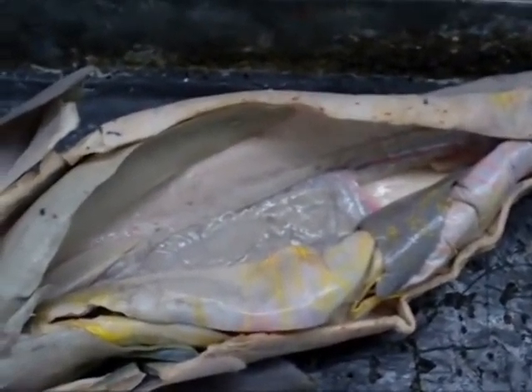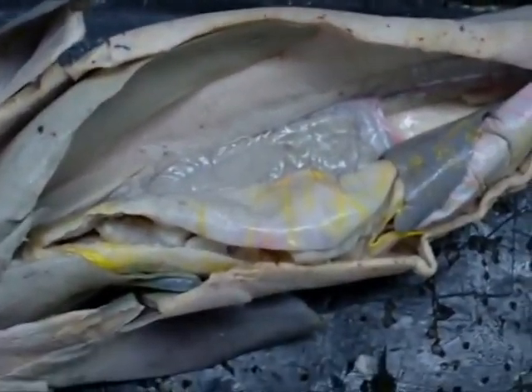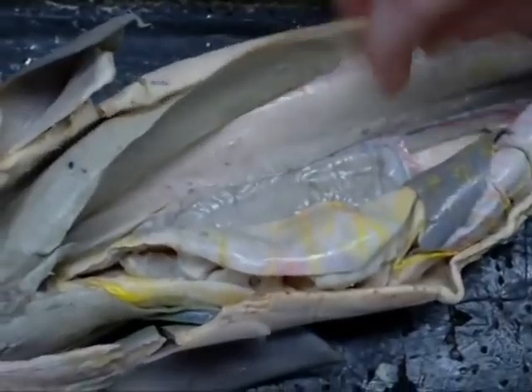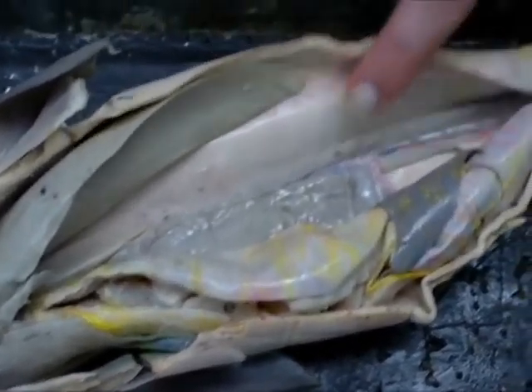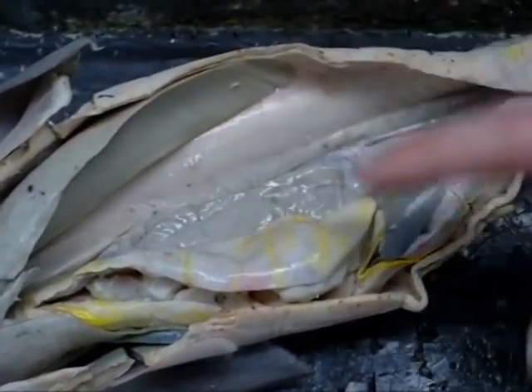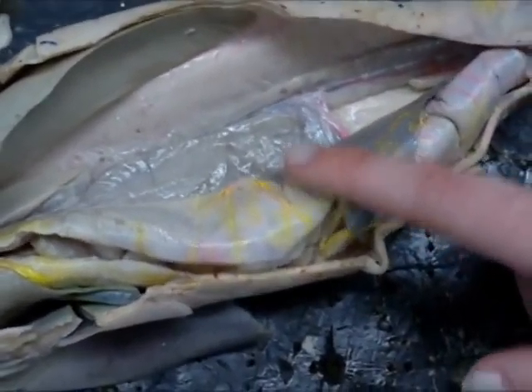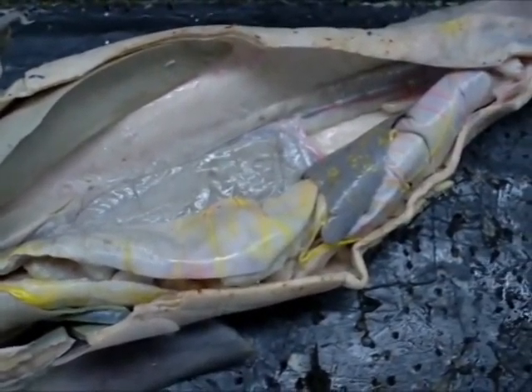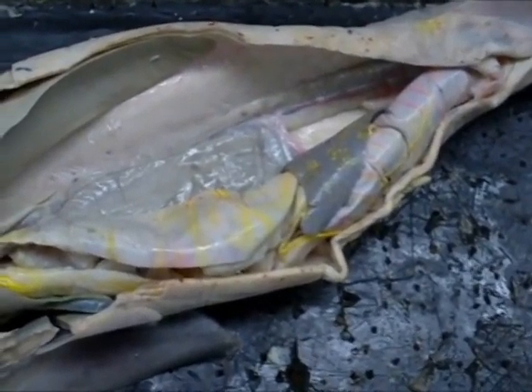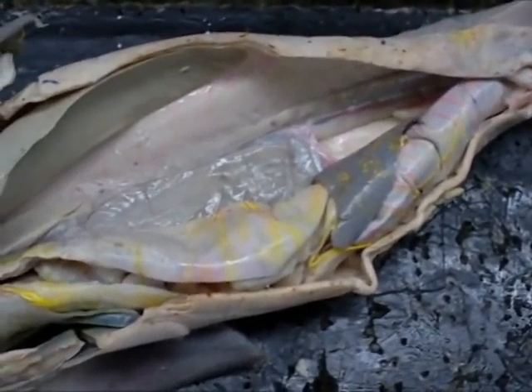Where are the layers for the coelom? The serosa layers. Parietal? Yep. Visceral is what covers the organs. I think there's like three layers, but those are the only two specific ones.